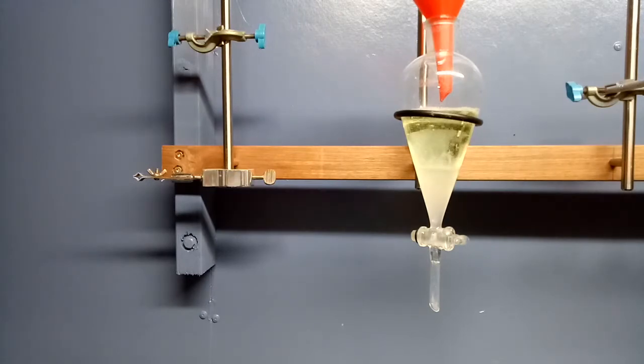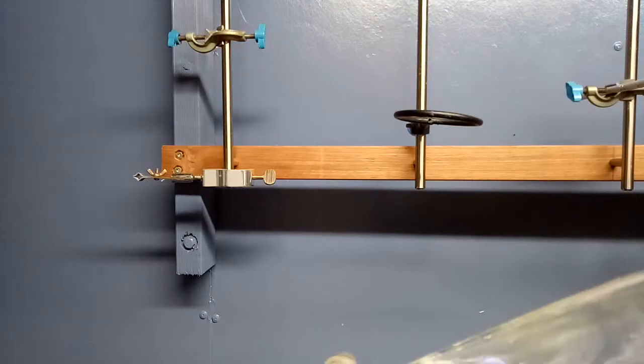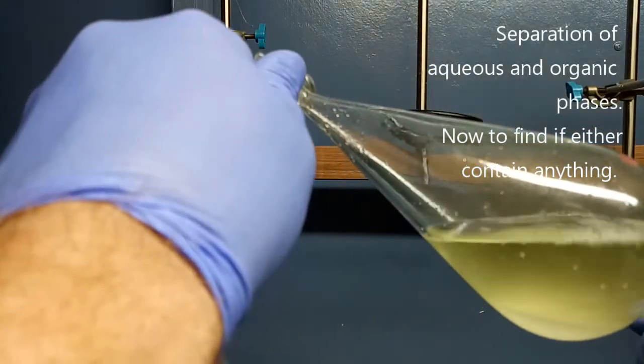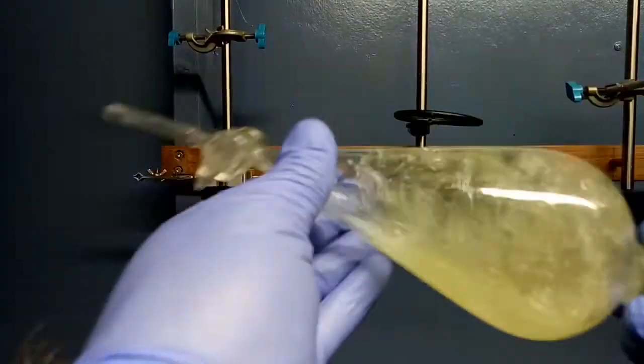Now, when people present these videos online, they usually just skip the steps where you're doing all the separations. I decided to have a go at filming it, and I actually understand why people skip over this a bit. But, this is a standard liquid-liquid extraction.